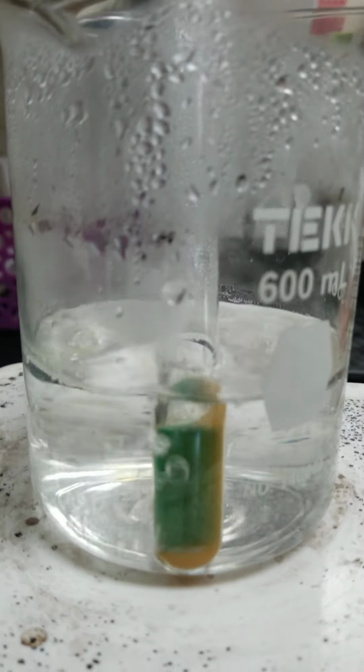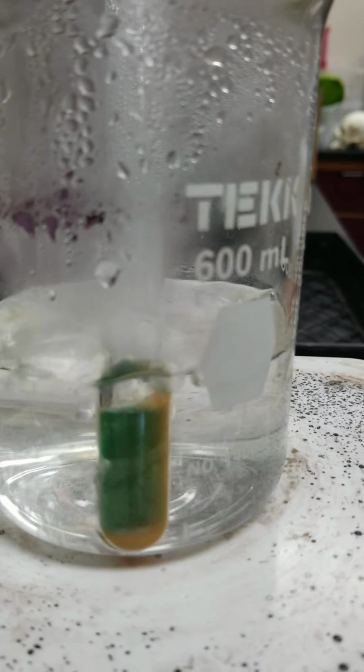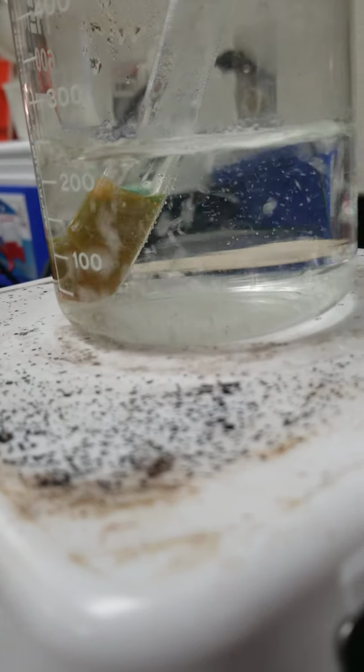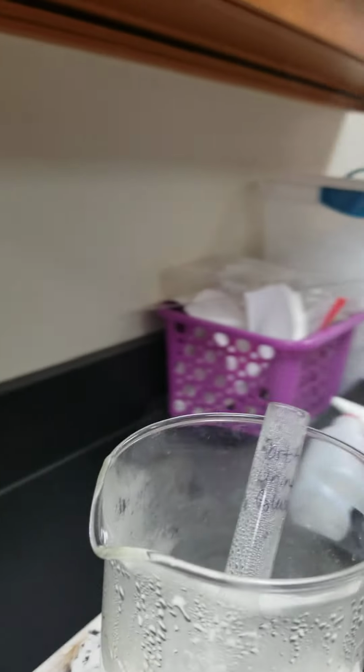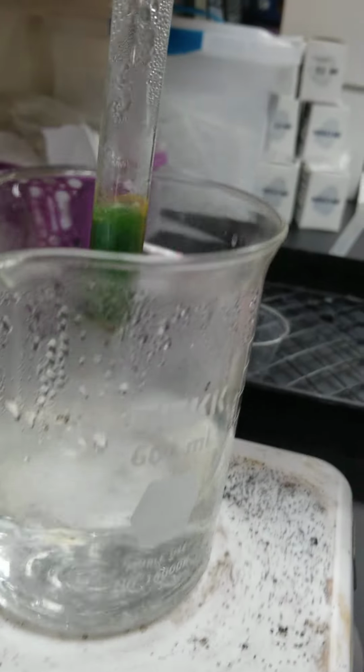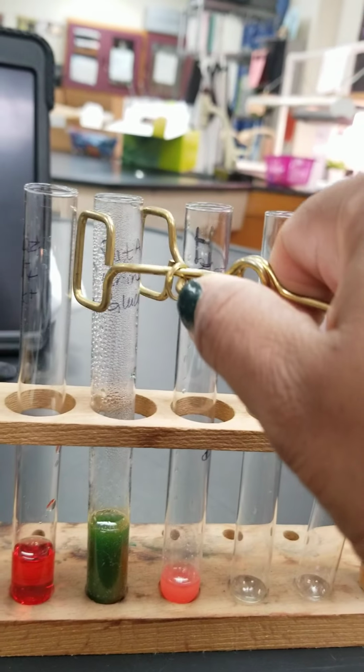Okay, so it's been enough time for our simple sugar test. So let's go back and check on our Benedict solution. You can see that on one side, you're still seeing that kind of greenish color that I mentioned before. But if we look on the other side, you can see more of a heavy orange type color. We could let this continue to run, and honestly, the only thing that's going to happen is the entire test tube will turn orange, but we're going to go ahead and pull this out. Okay, so you see a good image here, how it's kind of two-toned. We're going to stick that back on our rack.